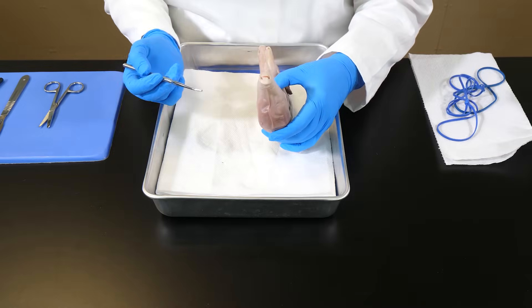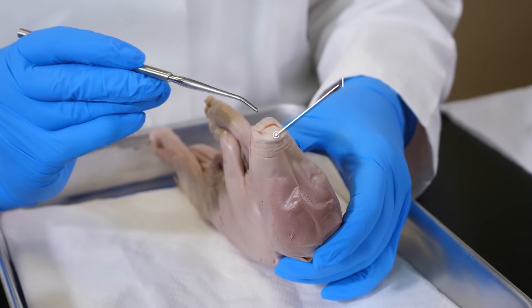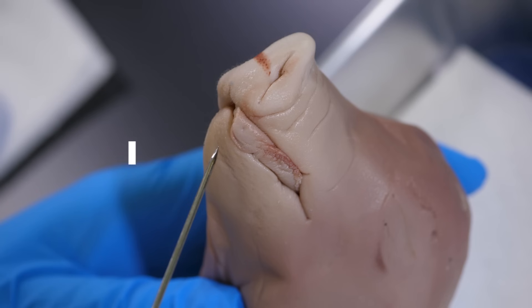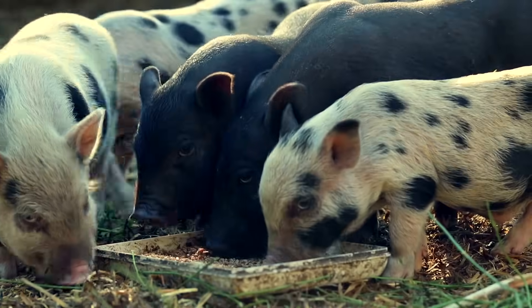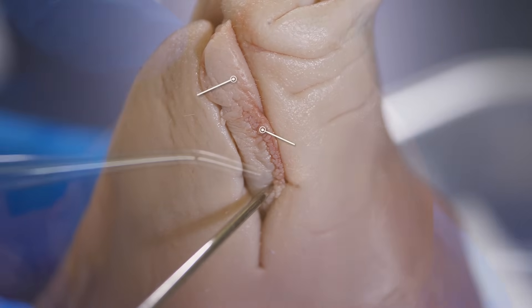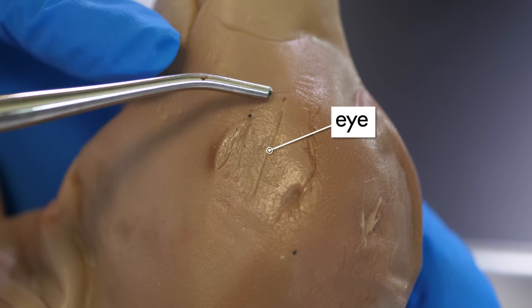One of the most distinctive features of a pig is its flat snout, located at the anterior end. Two nostrils, used for breathing and smelling, are located in the snout. Below the snout is its mouth. A pig is an omnivore — an animal that eats plants or animals. Along the edge of the pig's tongue are taste buds. Posterior to the snout are the eyes. The fetal pig is not fully developed, so its eyes have not yet opened.